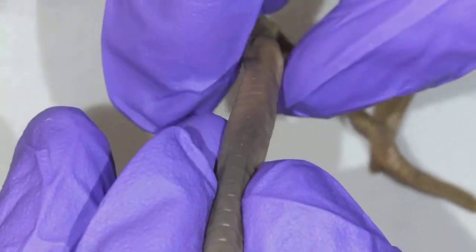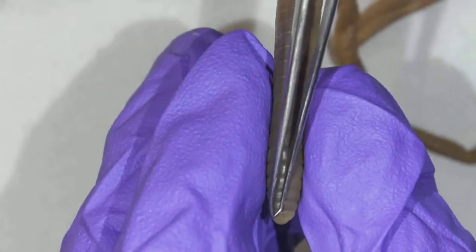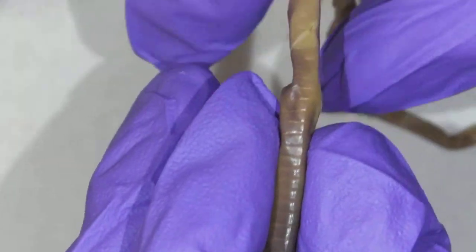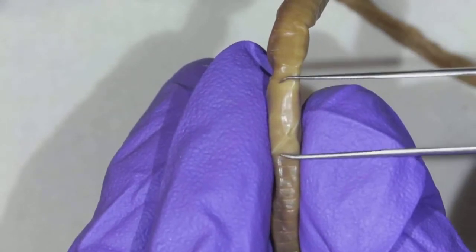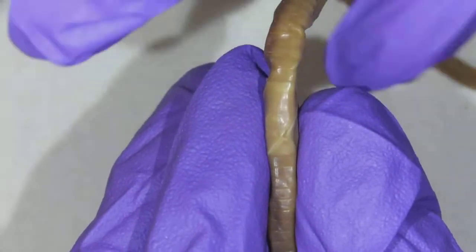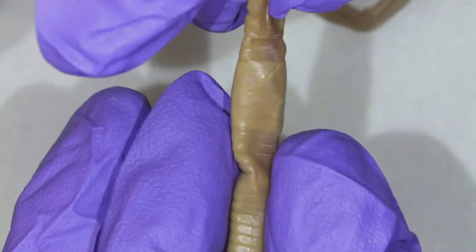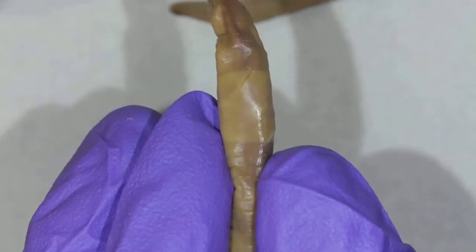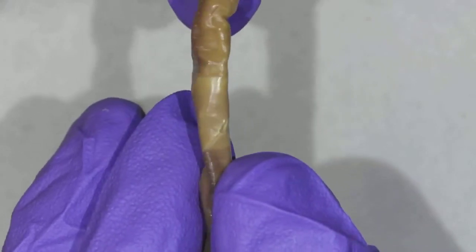So if I take that worm and go from the anterior, the head region, and move down the worm, I have to go a few segments down, and I find this area right here. See, I can kind of see it's a little bit different color. That is the clitellum. I want you to read about the clitellum. I'm going to roll the worm around. The clitellum is used in reproduction. Can you see it right there? Clitellum. It's a nice, easy to recognize structure, and you can see this on living worms too.